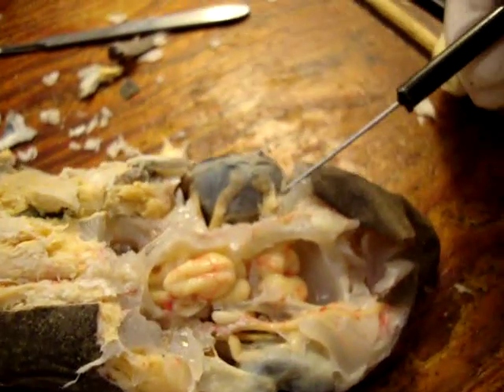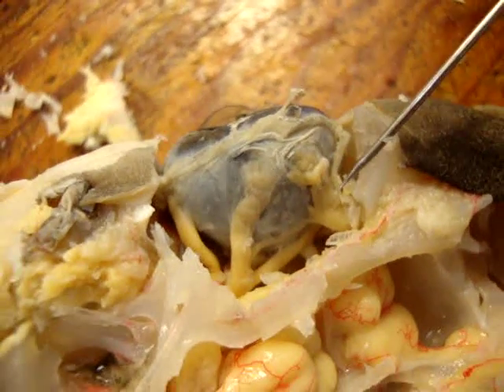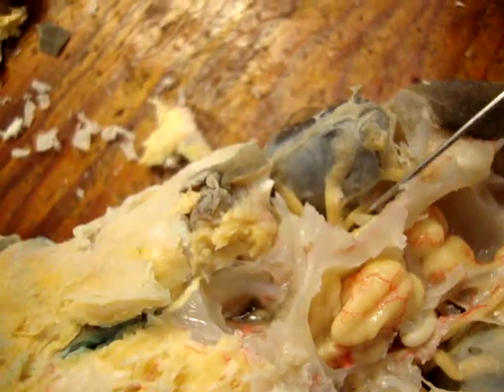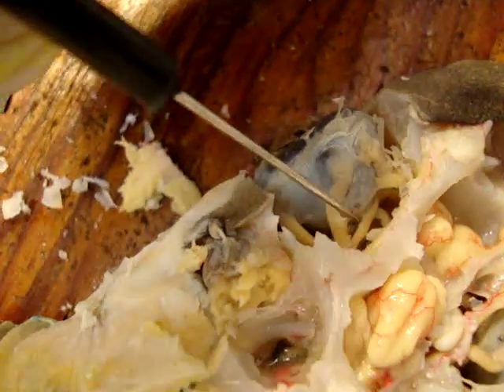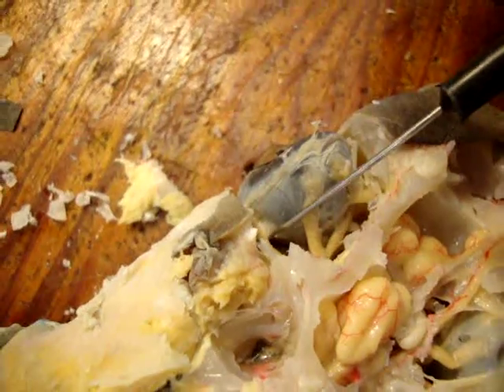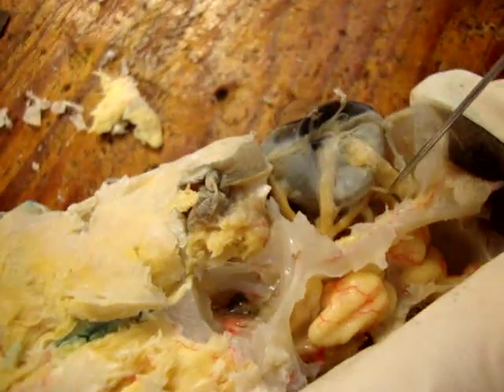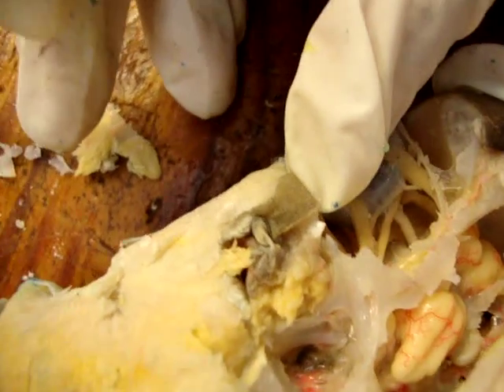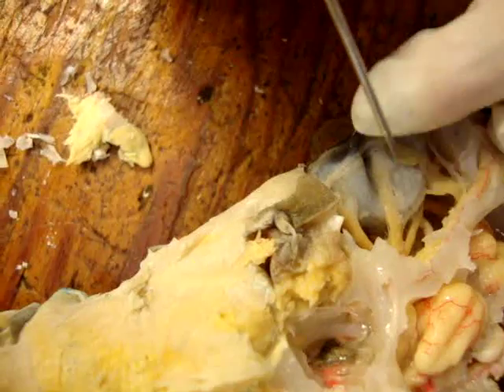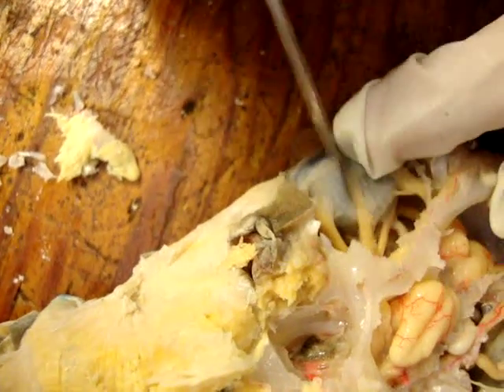This is the eye. This is the superior oblique. Superior rectus. Medial rectus is just beside it. And then this is the lateral rectus. You can see the optic nerve just down here — this white thing right there is the optic nerve.